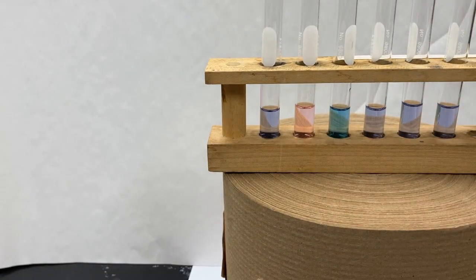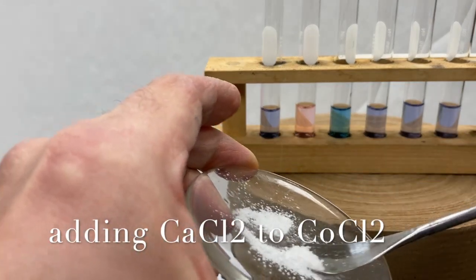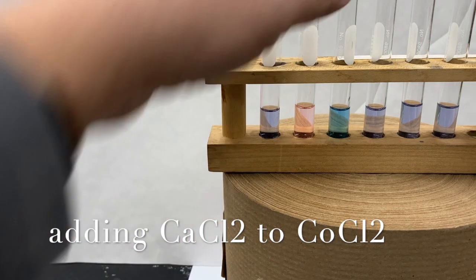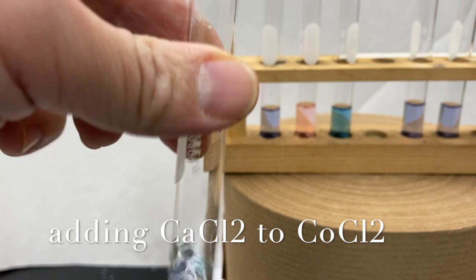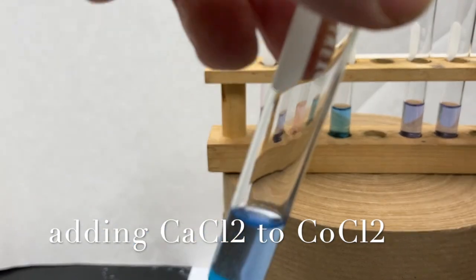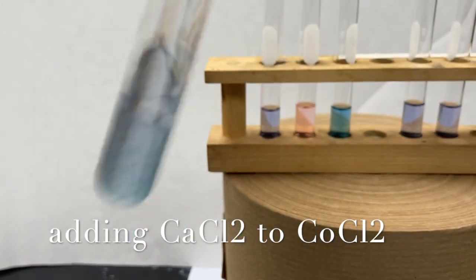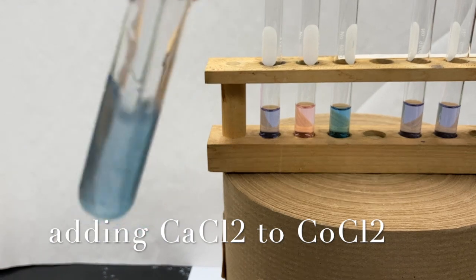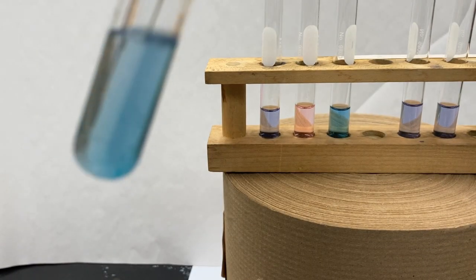So I'm just going to scrape some of this powder into the 4th tube. And we're seeing us change from our violet to our light blue. It's very similar to the hydrochloric acid.